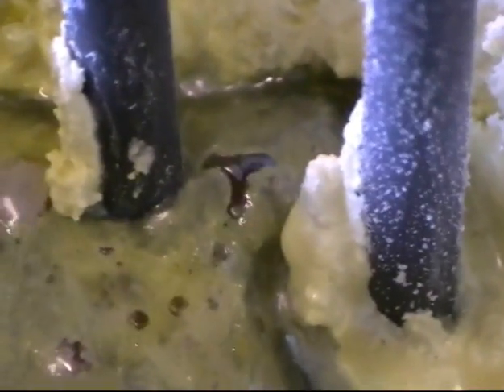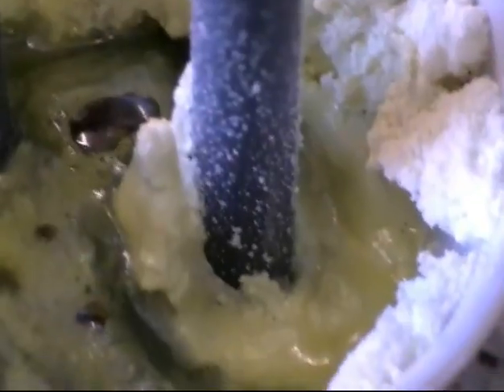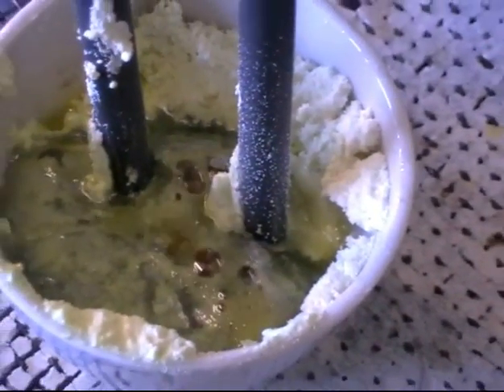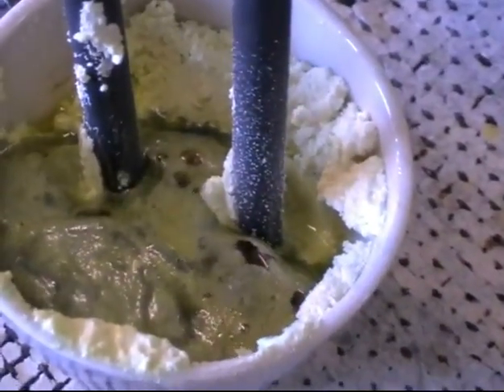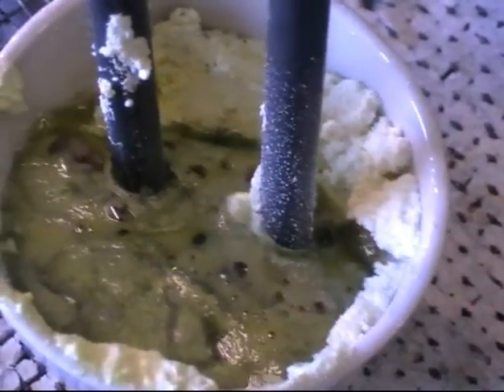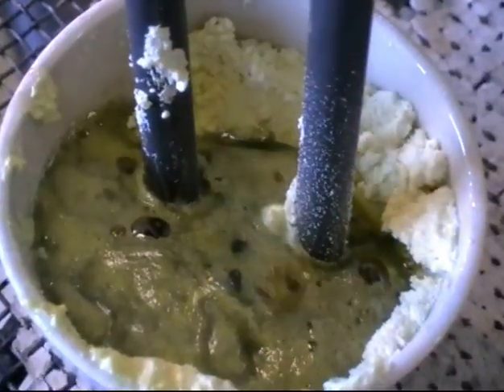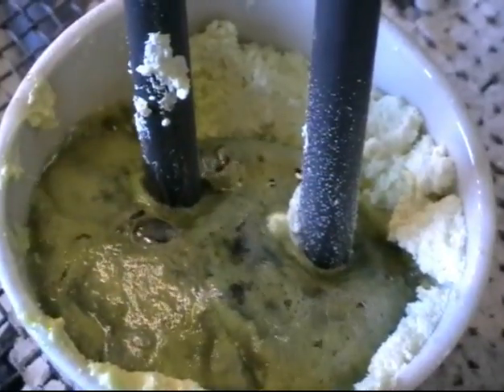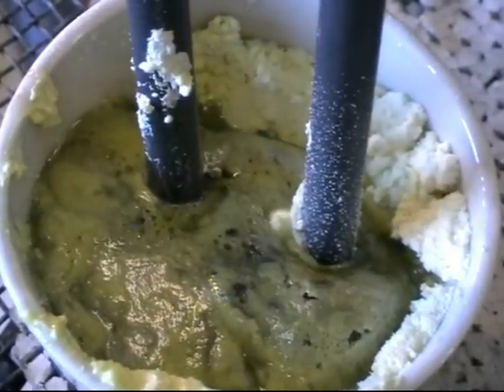If you leave it for long enough it will bleach the paper. So certainly gas is being produced at the left hand electrode, the anode. Over at the right hand electrode, it's not clear at this stage, but perhaps when we withdraw the electrode from the electrolyte we might see a shiny appearance of a liquid metal, a grey metal, which would be the lead. You may just about make out plumes of a brown gas — that's the bromine being produced at the left hand electrode. You can just see clouds of brown bromine gas being produced — a very poisonous gas.